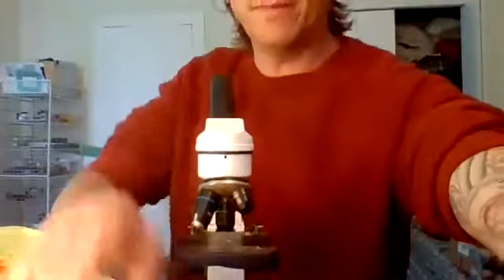Right now, I'm going to do a fecal sample for you using the materials that I have here. So I think I'll be out of the frame a lot, but we'll take it step by step and see what we can do here together. The process is simple, and more importantly, in the packet I gave you, it has a ton of resources. I mean, literally a ton.